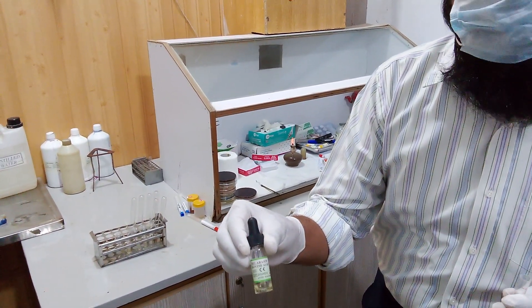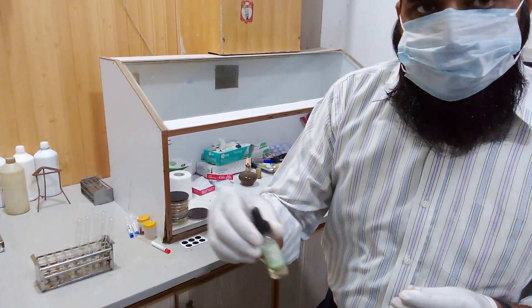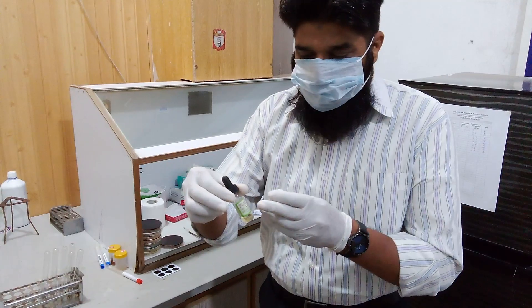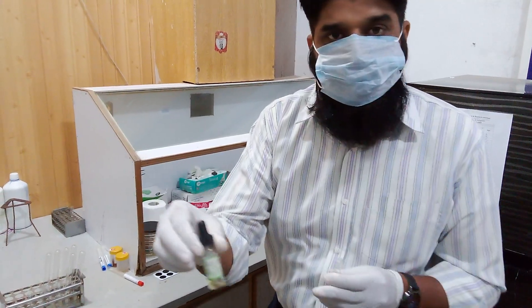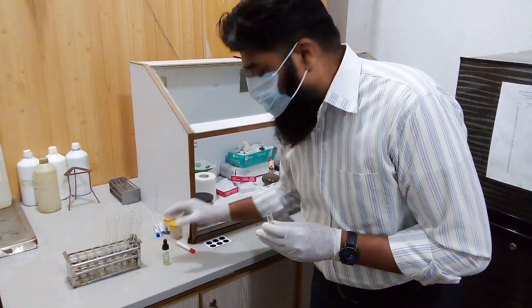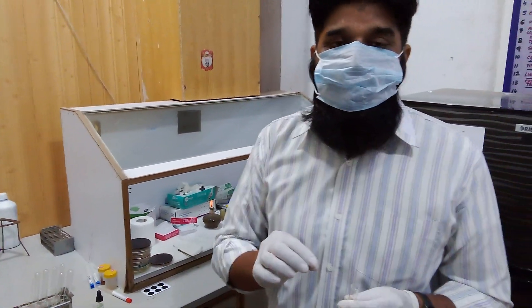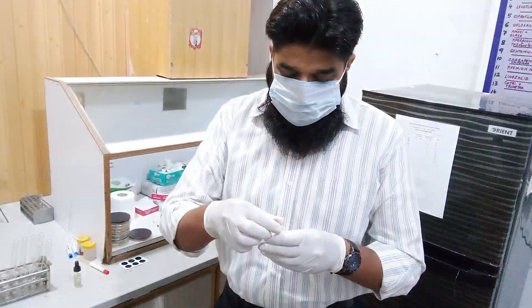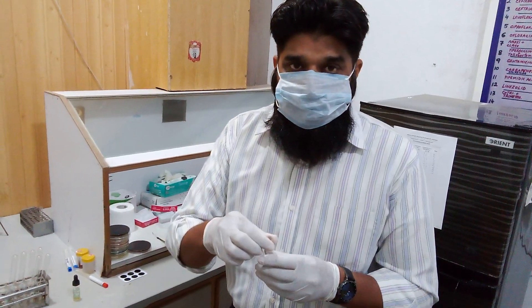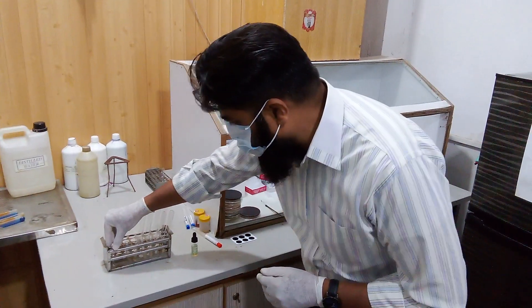Bovine means of cattle origin, and here I will demonstrate — this is bovine albumin. It is used in place of blood plasma. We will add 30 microliters of bovine albumin in the test tube. Then we will add 70 microliters of normal saline into this test tube.